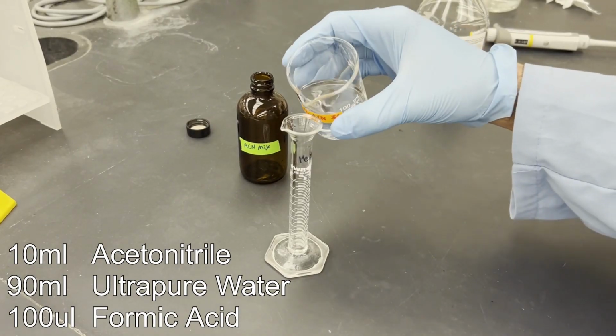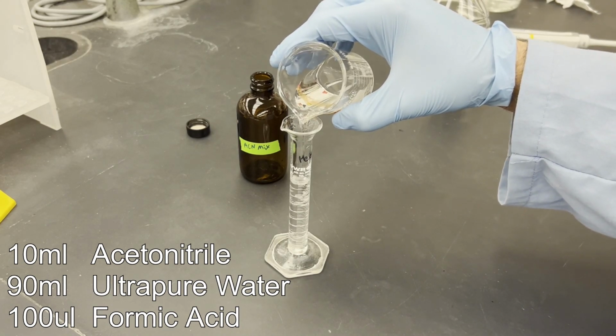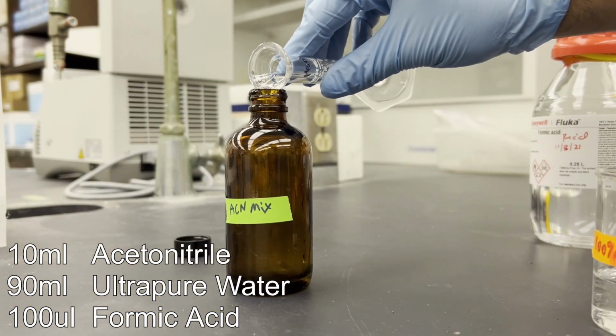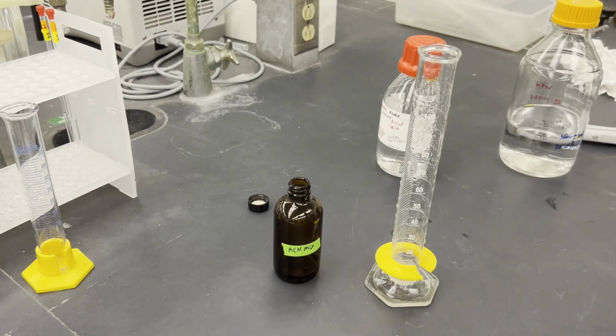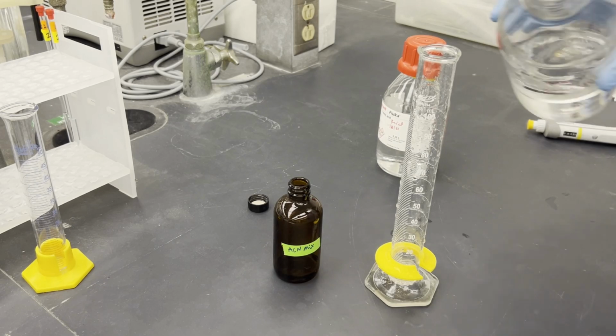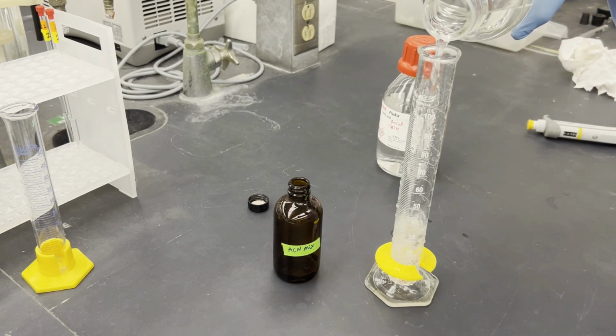Our samples will need to be diluted after derivatization, so we will be making a water and acetonitrile mixture for this. We'll begin by adding our 10 milliliters of acetonitrile to a clean chem-safe bottle. Follow this by adding 90 milliliters of ultrapure water to the bottle. You can add the acetonitrile to the glass using the pipettes, but I don't recommend adding 90 milliliters of water, 1,000 microliters at a time.